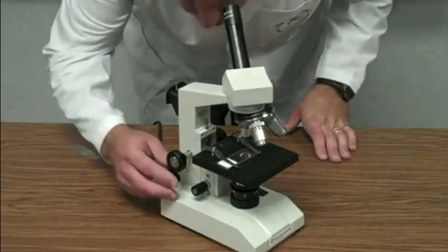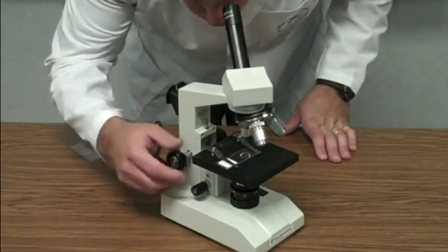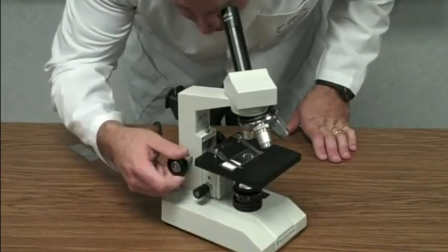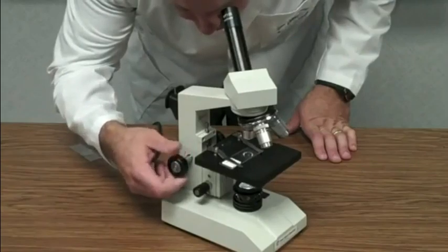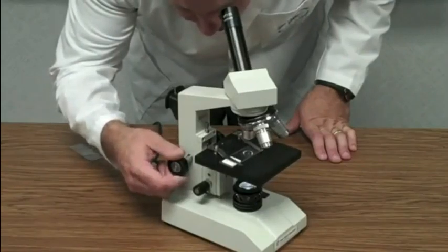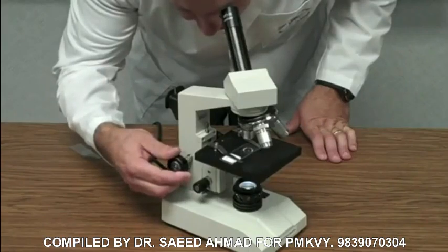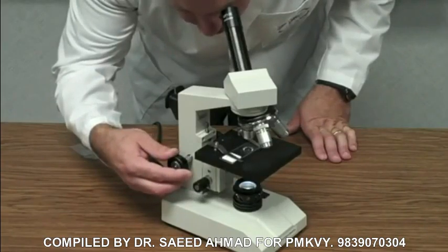And as I'm looking through the eyepiece, I'm going to use the coarse adjustment knob to roll the stage upwards very slowly until I can start to see something. And you keep rolling it, moving it until you see something. And there I go. I see that piece of frog skin.